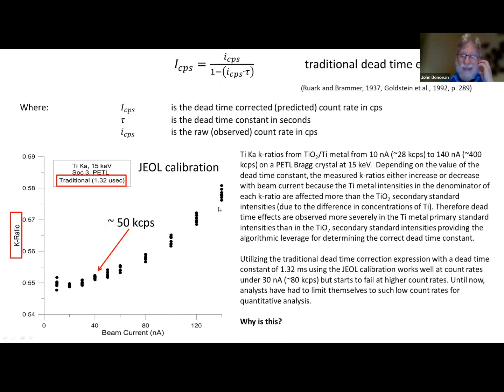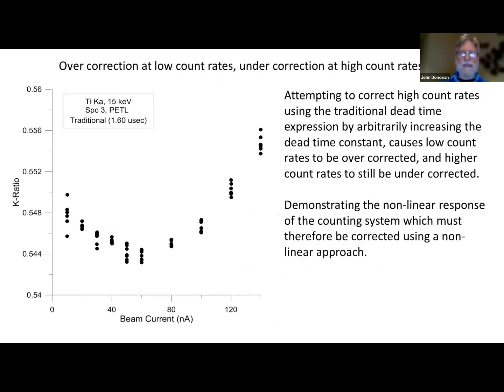That's great, but it starts to fail. So why is that? And we might say, oh, well, maybe the dead time constant really wasn't calibrated properly. Let's put in, instead of 1.32 microseconds, 1.6 microseconds. The problem is that overcorrects the lower intensities, and it still undercorrects the higher intensities. So this is not the answer, okay?